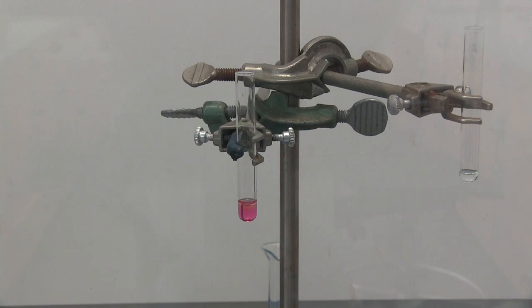There is a little bit of color change, I don't know if it's showing up on camera. There's a thin layer up here at the top that is kind of a brownish yellow. So that is positive for a double bond.